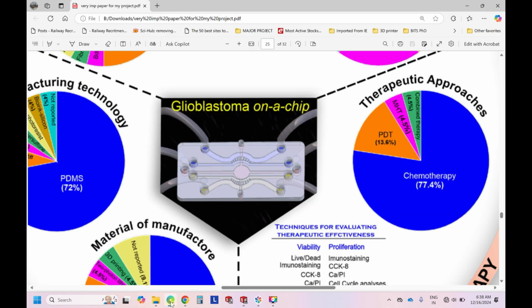So same like this paper, and if you observe, the light pink color channels have lower channel dimensions than the outside dimensions. For example, the blue, red, pink and yellow, these three have similar channel dimensions. However, the outside two channels have a broader channel width when compared to these inner channels. We'll also do the same way.